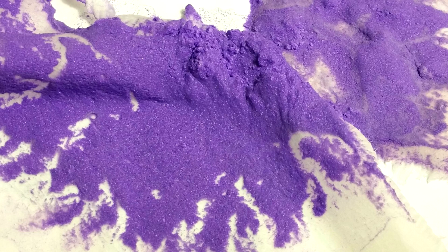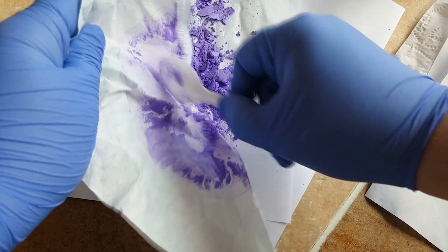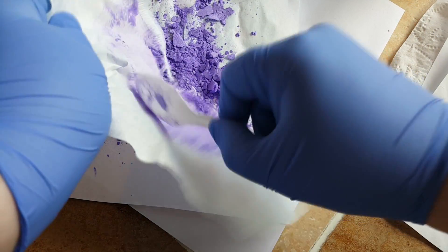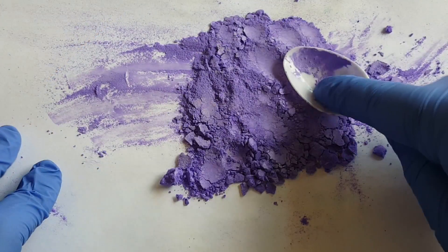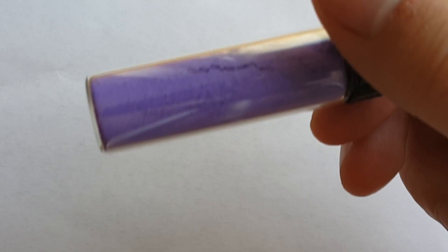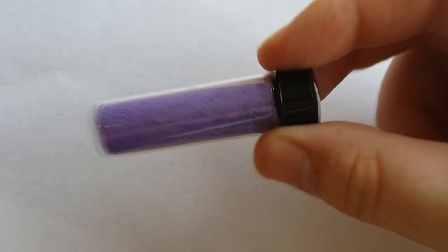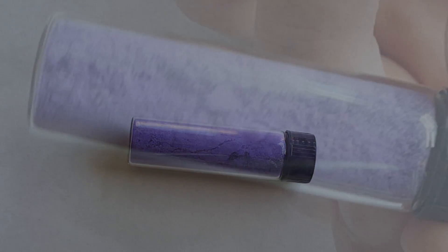After a few days of drying, it's finally ready to be taken off the filter paper and powderized. Now that the solid has been completely powderized, I'm going to go ahead and transfer it to a small dram vial. This is the compound in all of its glory. I may have said that it's pink throughout the video — it's more of a lilac color, but during the reaction it was very deep purple. A lot of papers, especially the one I linked, define it as a lilac color, so that might be a better name for what this is.